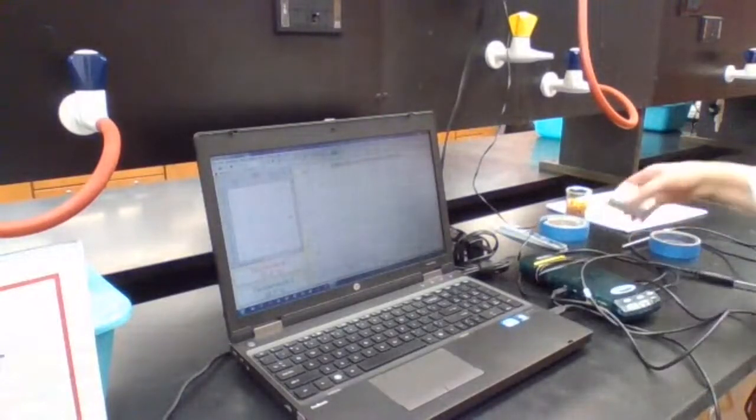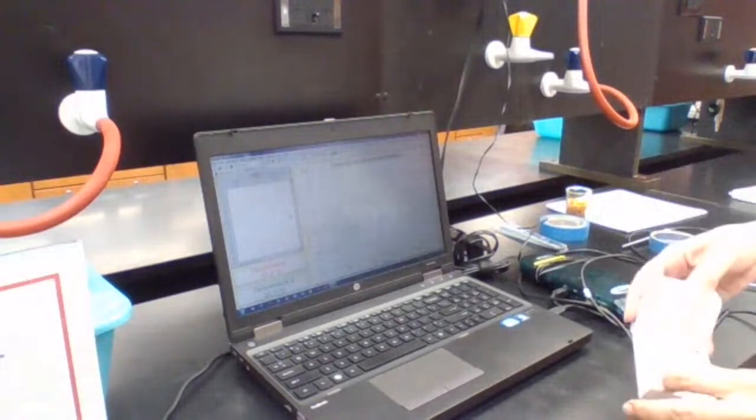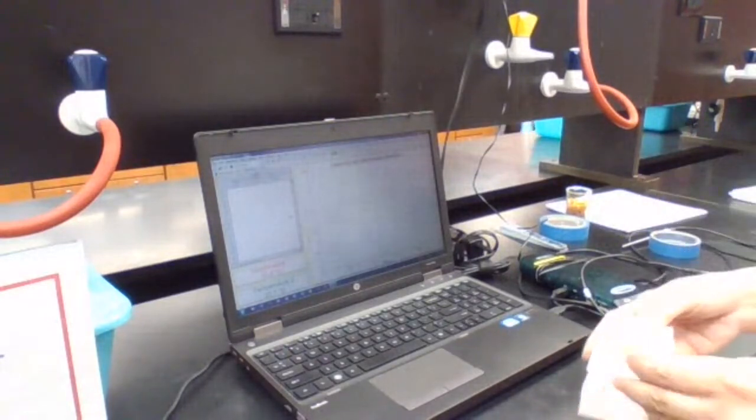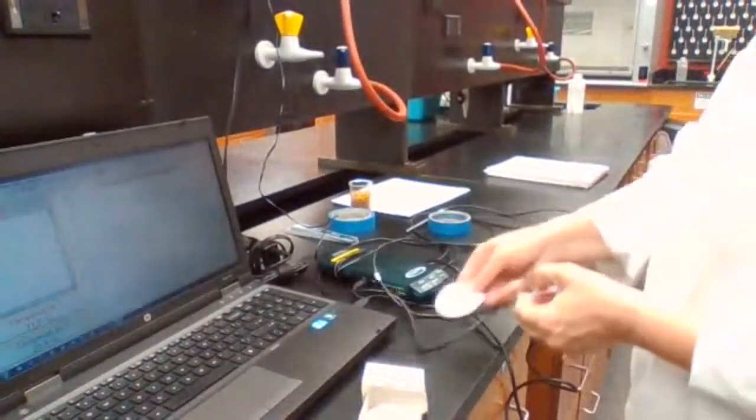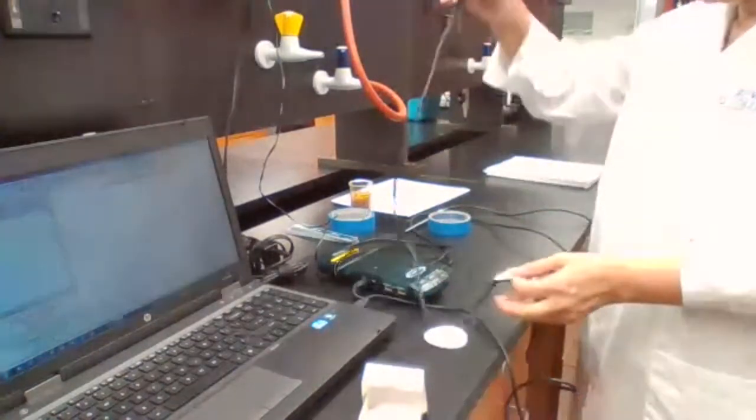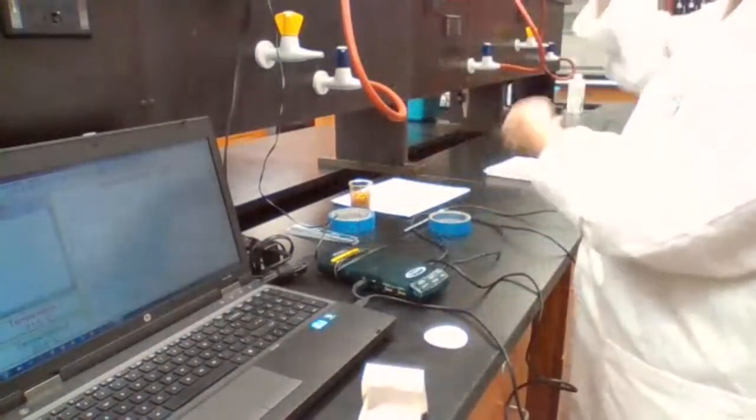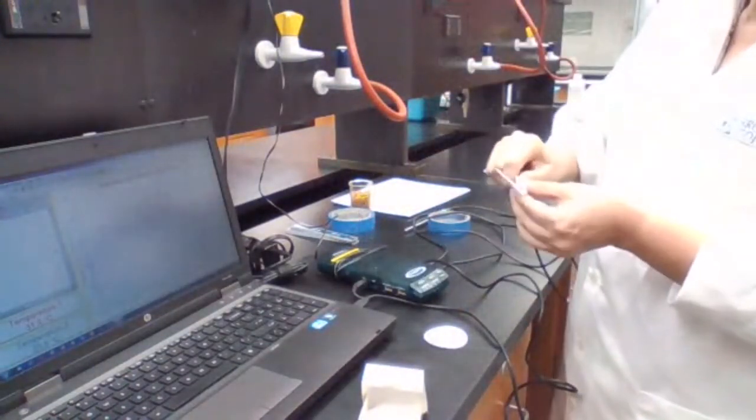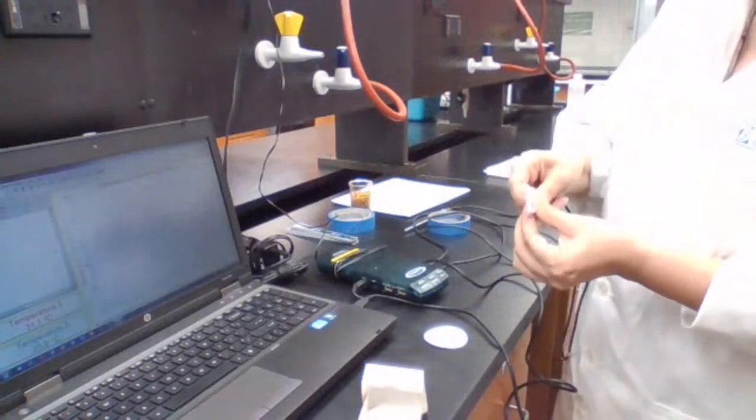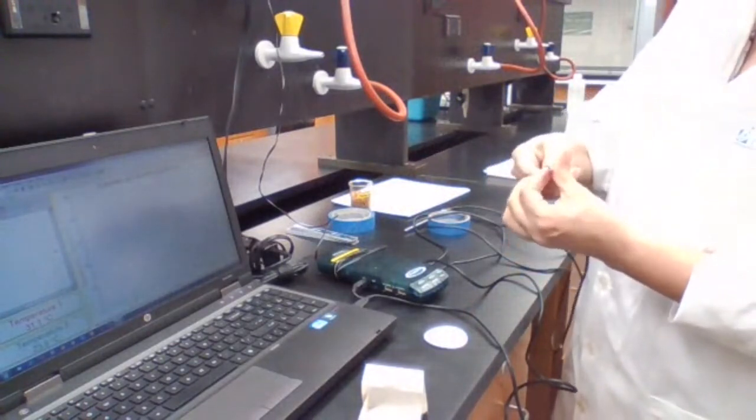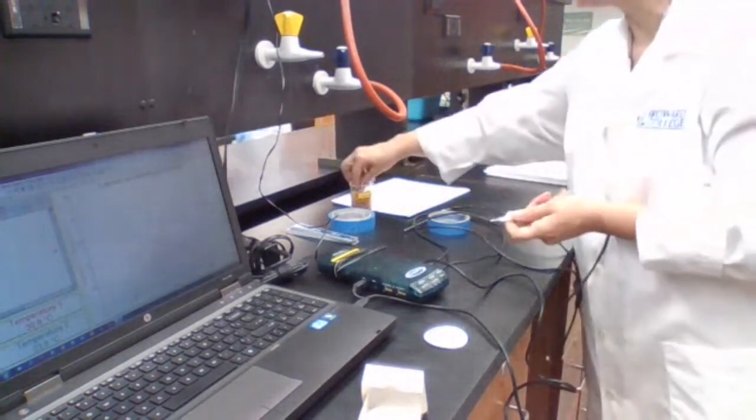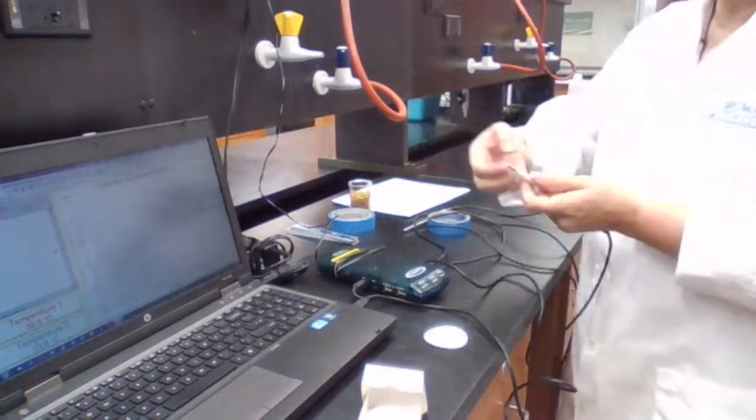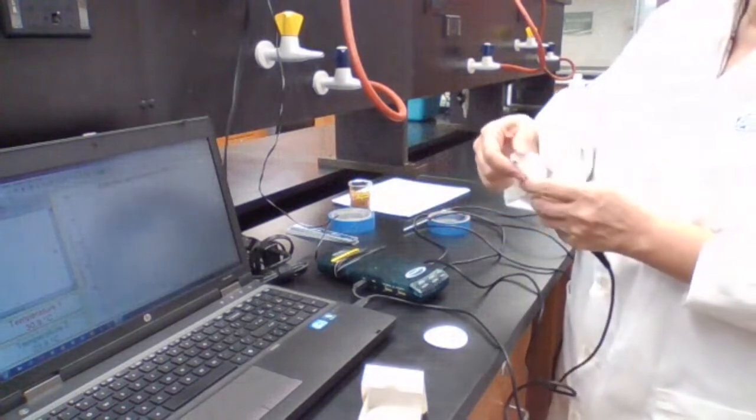The setup for this experiment is very simple. You take a piece of filter paper and you're going to secure it, roll it around the thermometer probe, because we want to make sure that you get a significant amount, at least some of these samples on the filter paper.